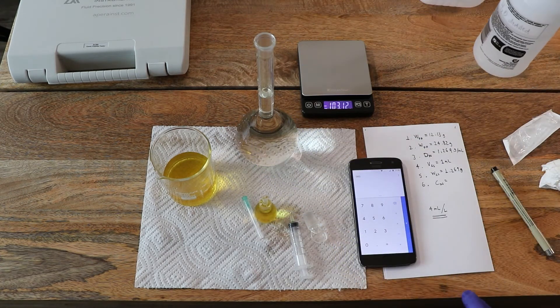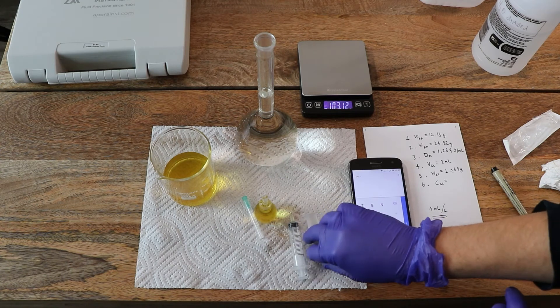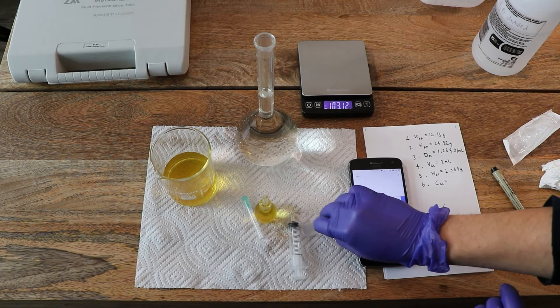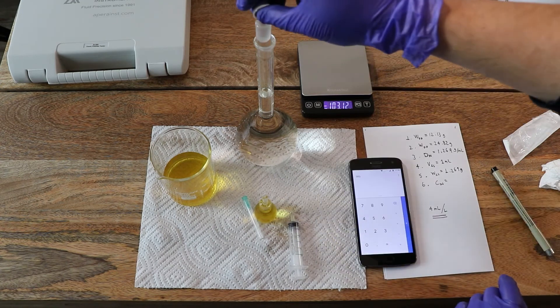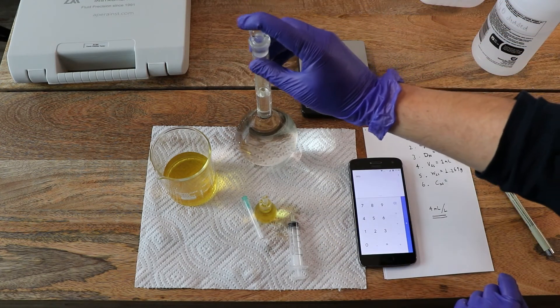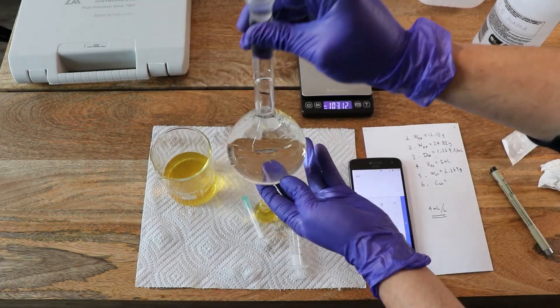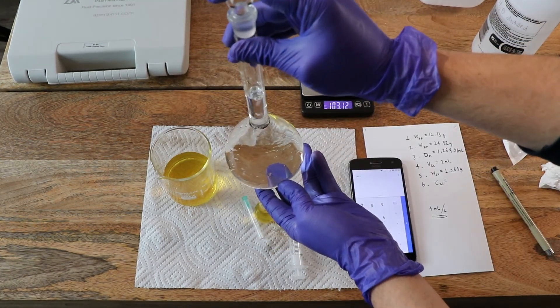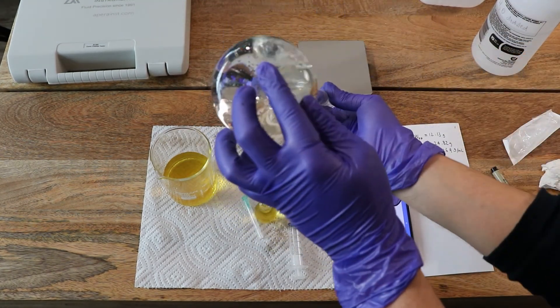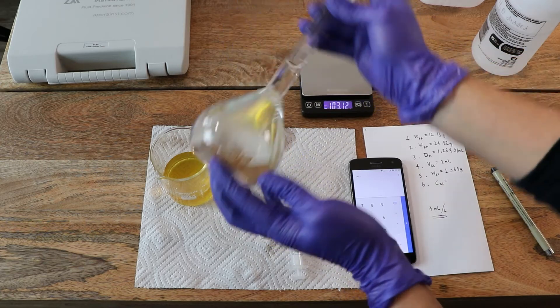Now I'm taking this to the final volume of 250 milliliters using distilled water, and now I'm going to homogenize this solution.